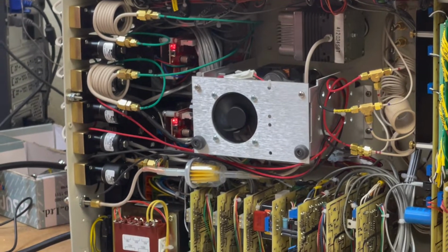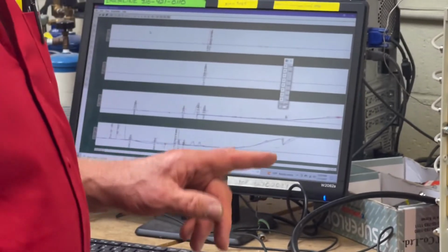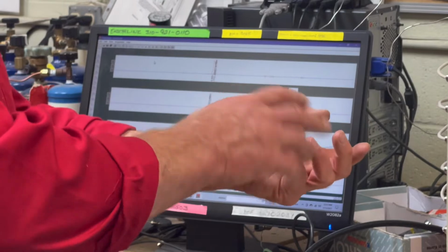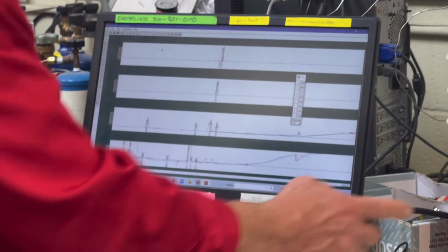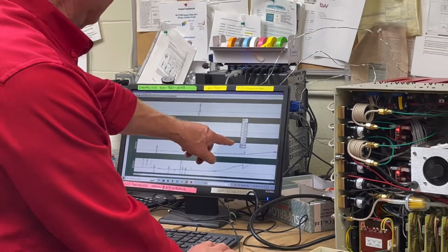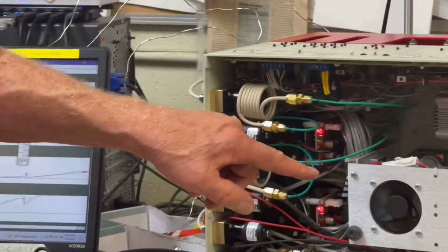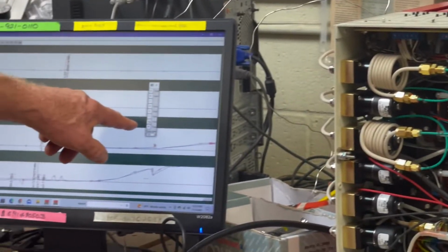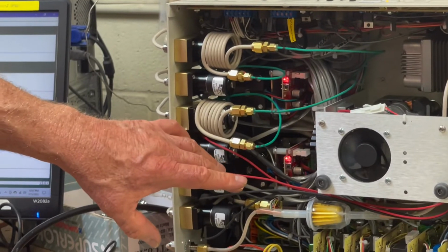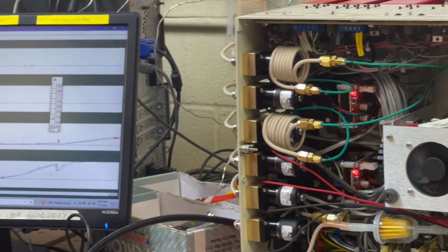So you would do this if the valve for some reason did not act normally, or if you were to move the head of the valve so that it needed to figure out where the new stops were. It would be good to do this. But the way the valve acts normally is that if I'm connected from Peak Simple to the GC, when I actuate relay G, the valve turns, right? And when I deactivate relay G, the valve turns the other way. Listen for the sound. I'm going to do it again.